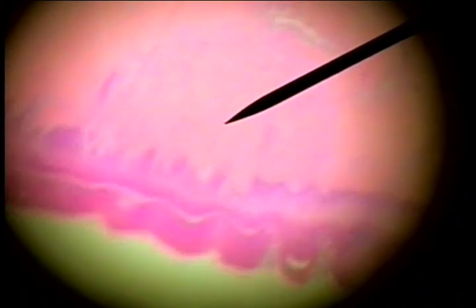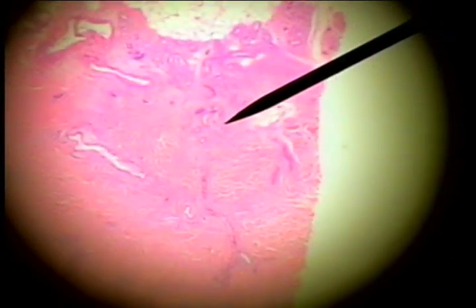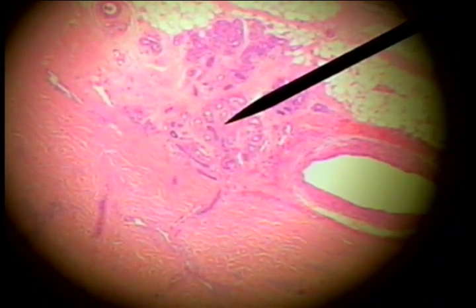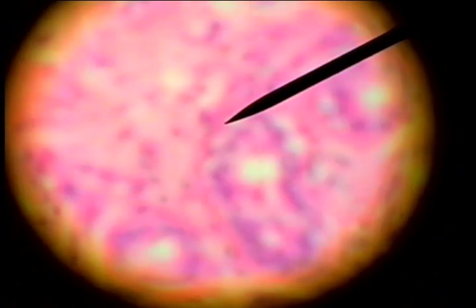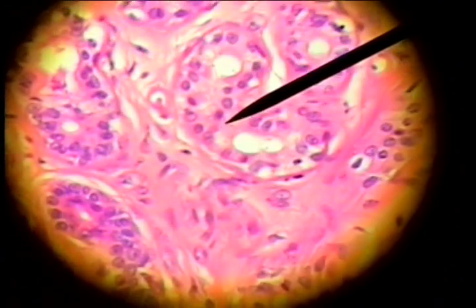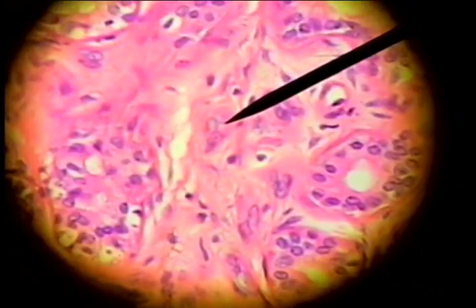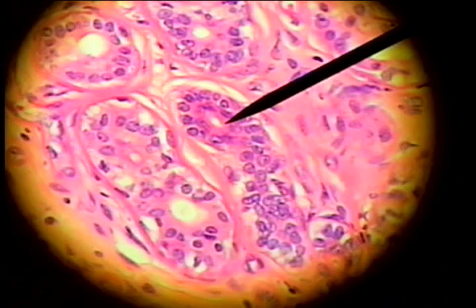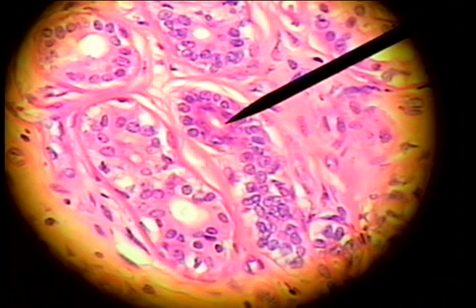If we go back to a lower power and scan the dermis, we should see a sweat gland. There's no hair and no oil glands, but we should find sweat glands — and this looks like a sweat gland complex. At higher power, we see the cuboidal cell clusters forming the glands, and the darker colored duct conveying the sweat to the surface of the thick skin.